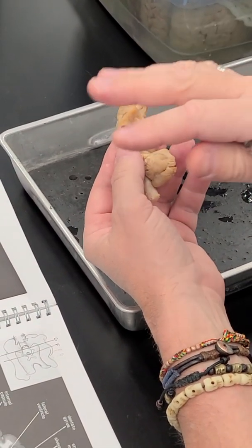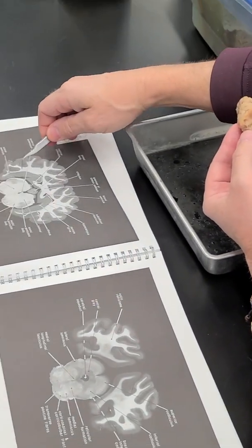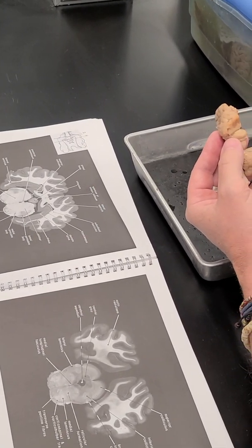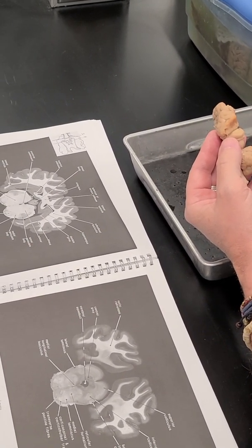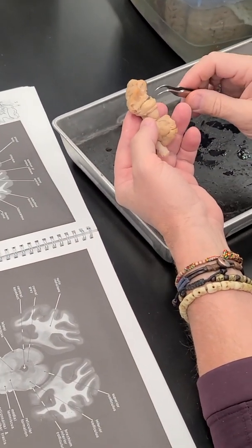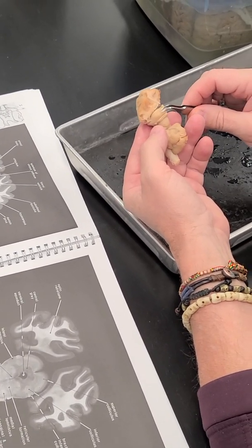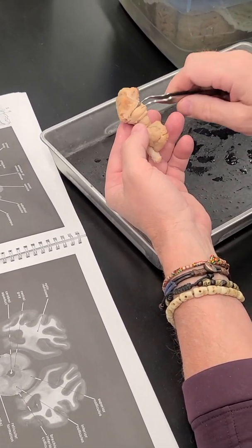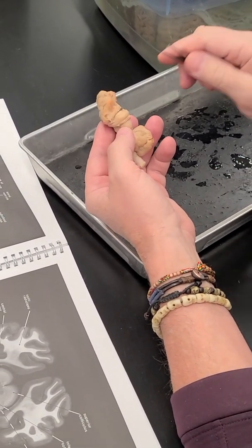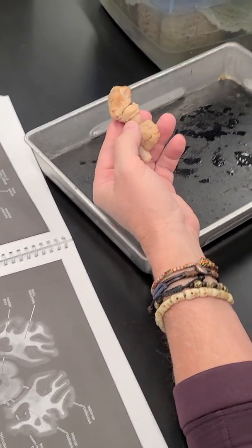And so it's hard to tell in these, but if you look at these views, you can see that it's really a continuation of the neocortex, and it's laminated. It has layers of cells and fibers like the cortex, but it's highly specialized. And so on the surface of the hippocampus, here we can see this white layer, which is a layer of axons. And these axons over the body of the hippocampus are called the alveus.